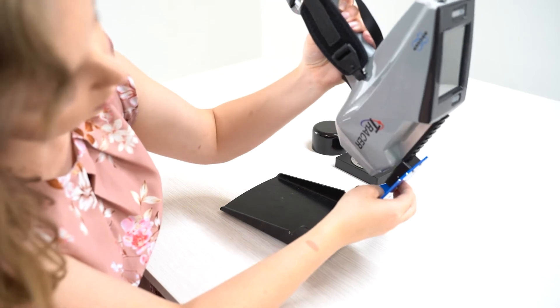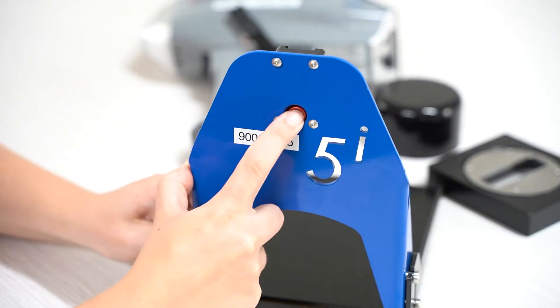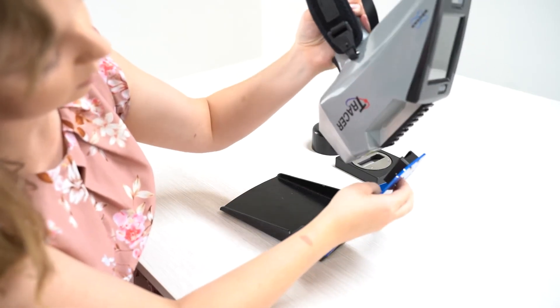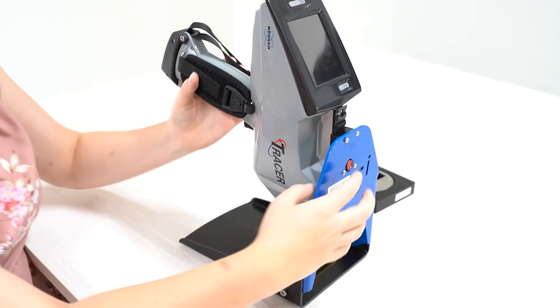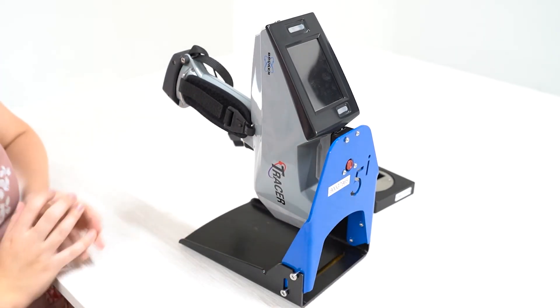To analyse facing downwards, start again at the 45 degree angle. Click the button to release the rail mechanism and slide the tracer downwards. From here, in an up and over movement, you can move the tracer into a 90 degree angle, ready for analysis. If you are unhappy with the position, use the button to adjust.